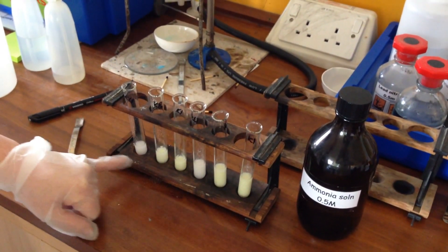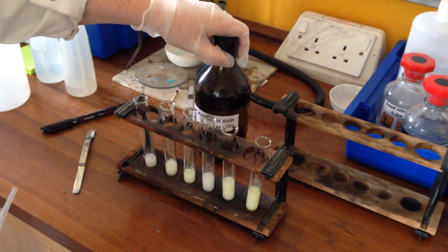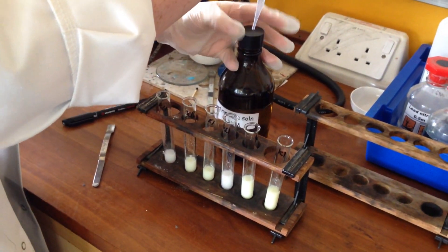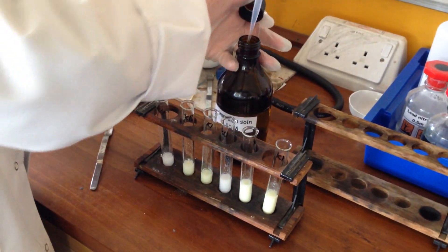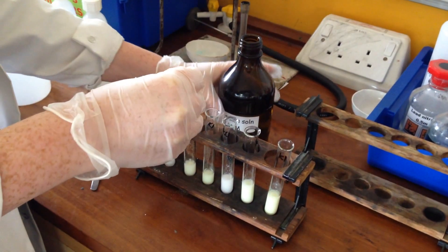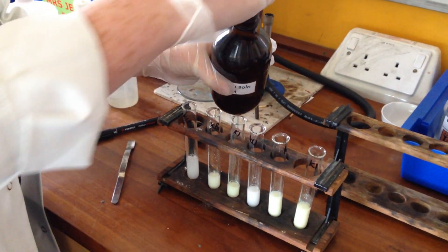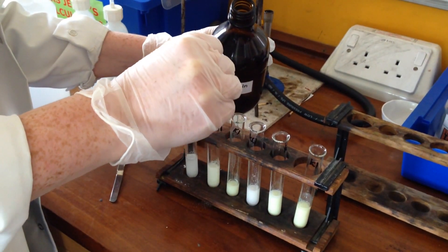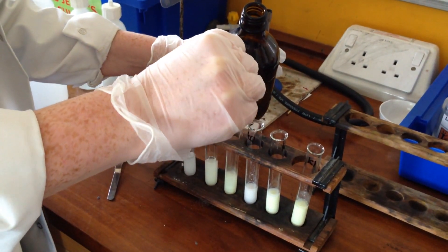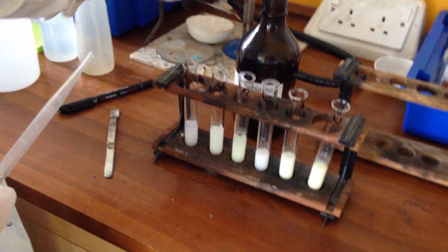I've divided these in half now. And to this half I'm just going to add some dilute ammonia solution. And we can see that not a lot happens.